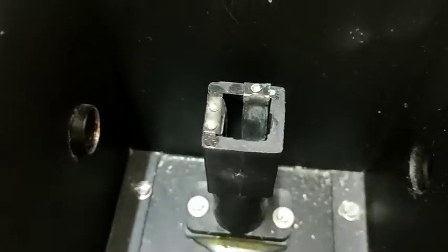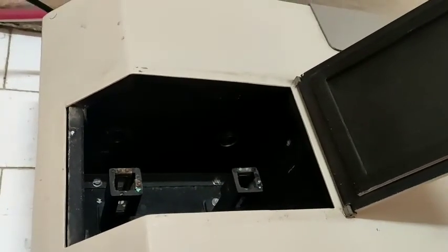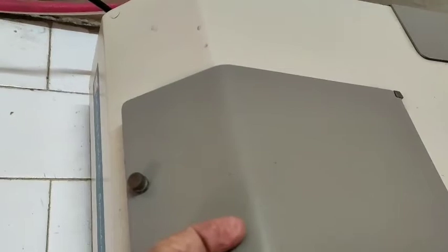There are two different cuvets: one is for reference (first one) and the second one is for the sample. You can see that two cuvets can be placed easily because cuvets are rectangular in shape, and that's why their holder is also rectangular. In the first holder on the right side you will put the standard or blank, and on the left side you will put the sample solution.